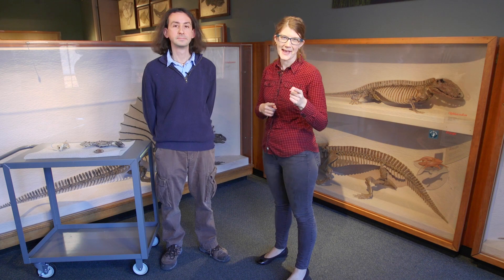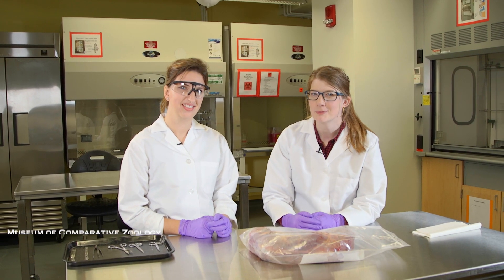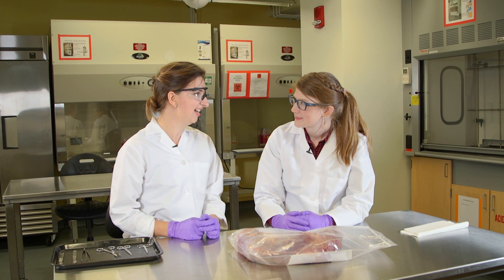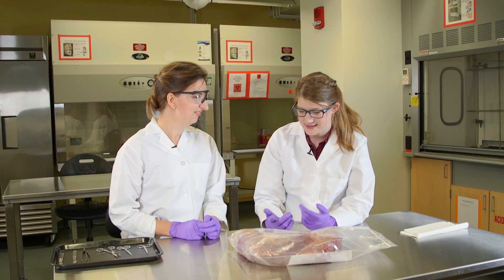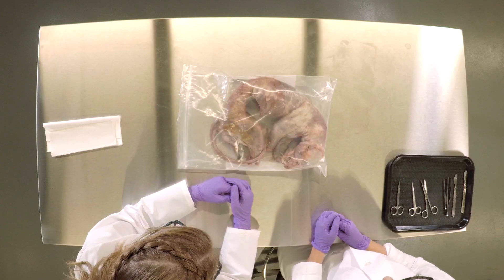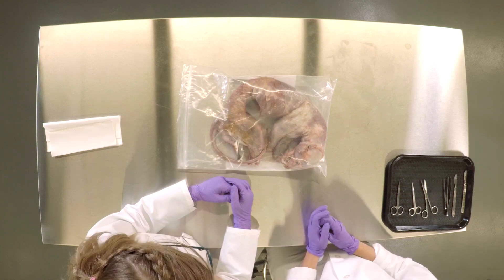So we're going to the Prep Lab. We are here in the preparation lab at Harvard's Museum of Comparative Zoology with Dr. Katrina Jones. Katrina is a researcher here at the museum who studies the anatomy and evolution of mammals. And what we have in this bag in front of us is a fisher cat — today we're going to be dissecting out its vertebral column so that we can do experiments on it.